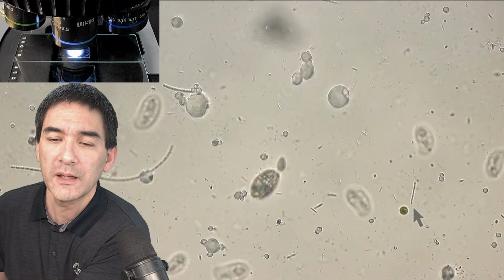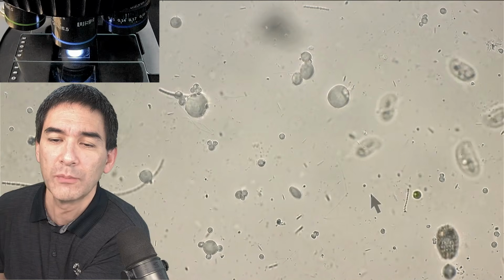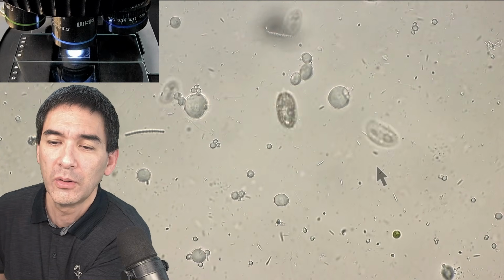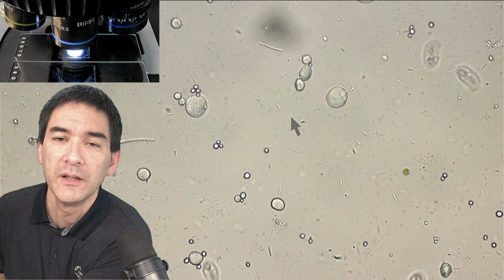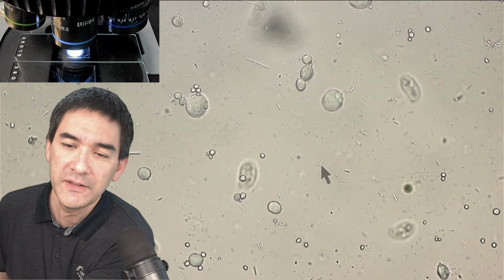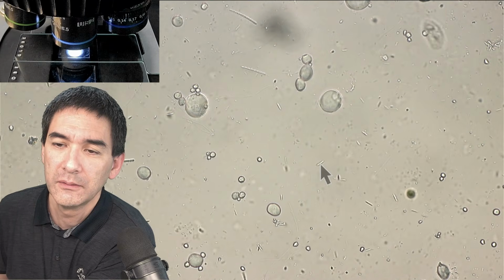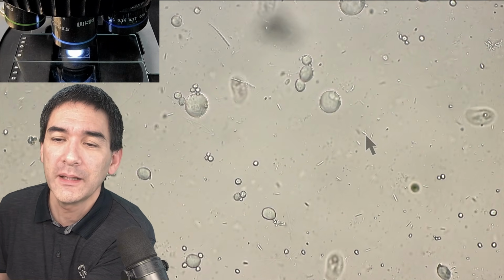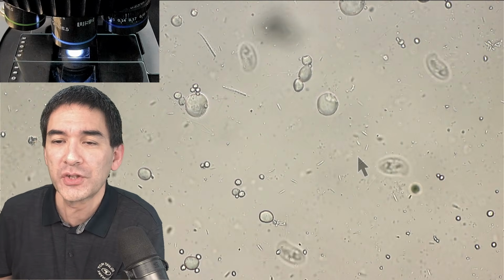Yeah, so I can put them back into focus, right? But let's put our attention to the small little things that you see here. Those rod shapes here, those long little line shapes. These are bacteria. These are prokaryotes. So these are of course also cells. They also have DNA. Obviously, all cells have them. Almost all cells have them. Let's be biologically correct here. And they basically don't have a nucleus, and they're much simpler.